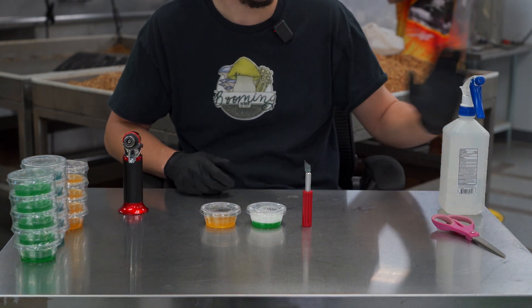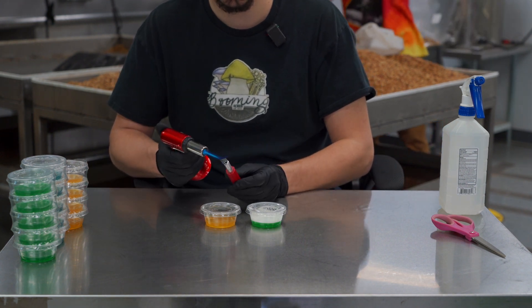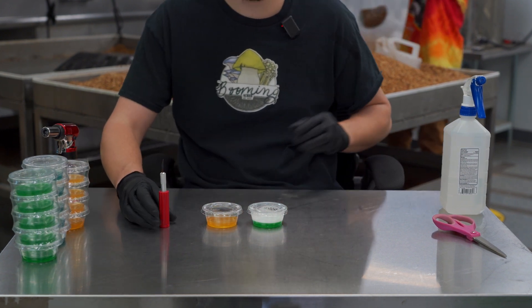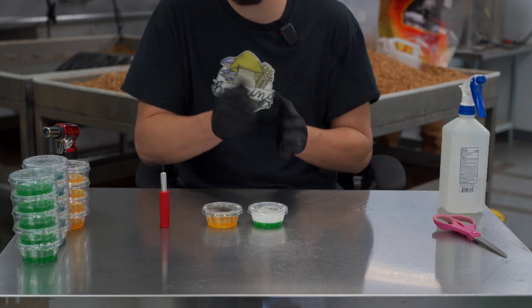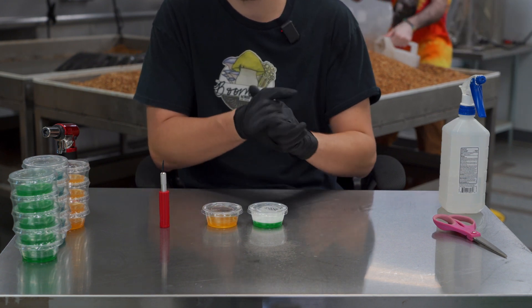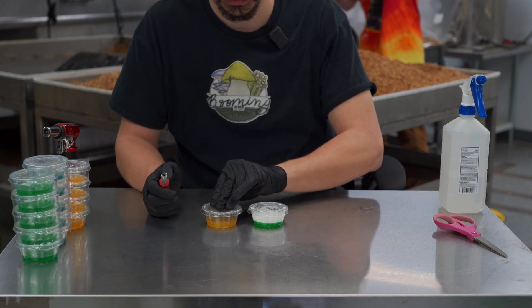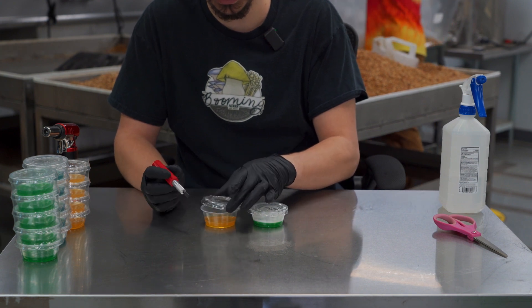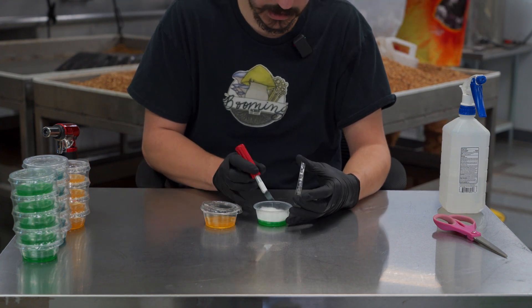Now to do a transfer, we're going to heat up our scalpel blade until it's red hot. While that's cooling, it's a good idea to alcohol spritz your hands again. Now all you do is unclip the lid and tap your scalpel blade into the fresh cup.